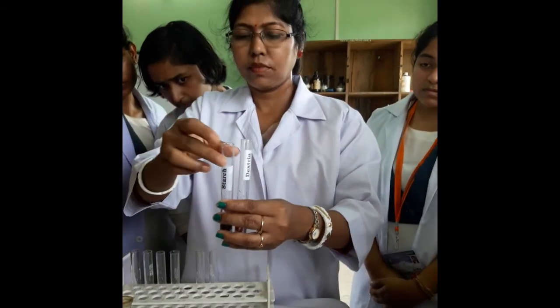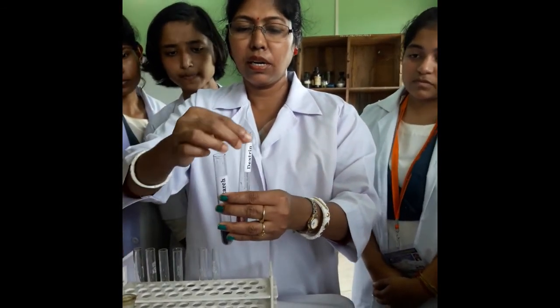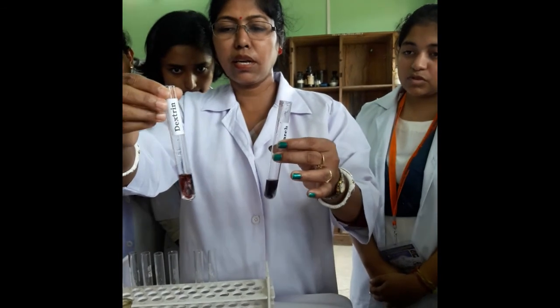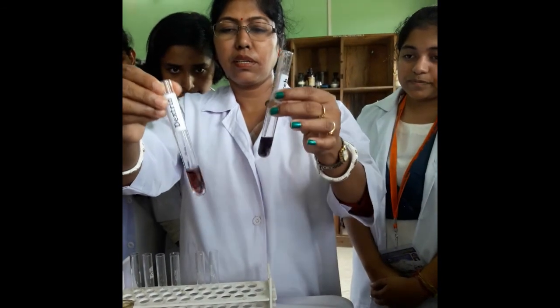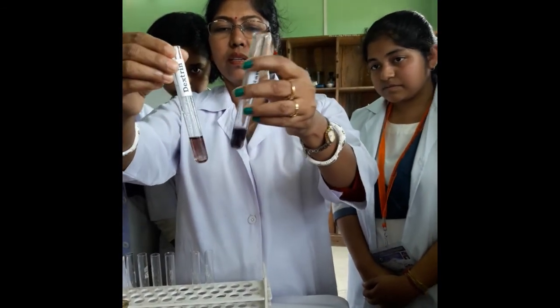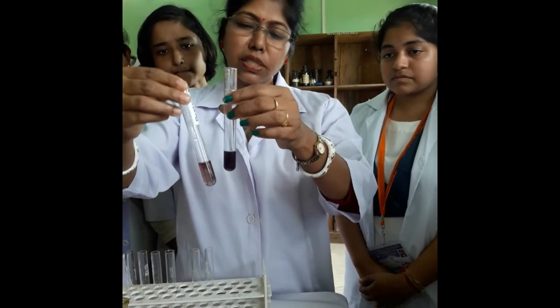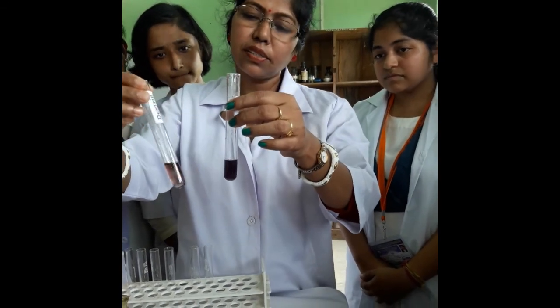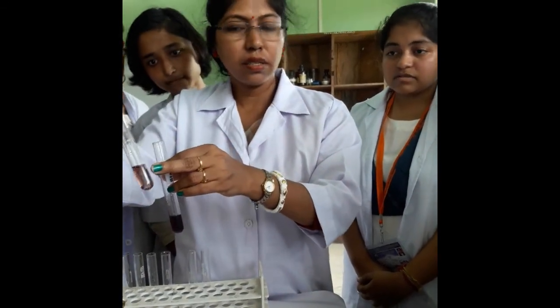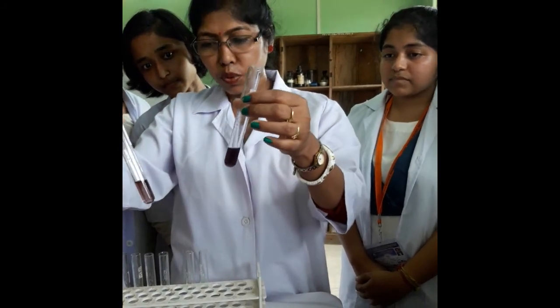Adding two drops of iodine to the dextrin sample. This produces a different color — a brown color, a bright brown color — confirming the presence of dextrin.